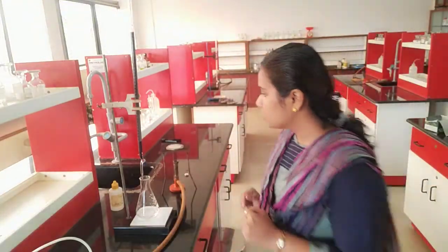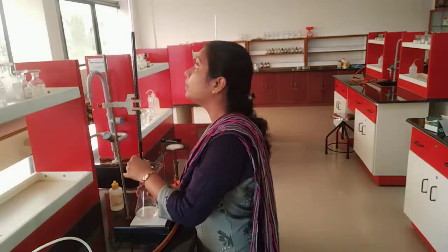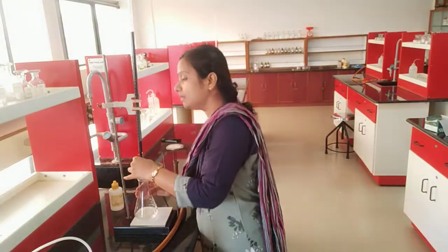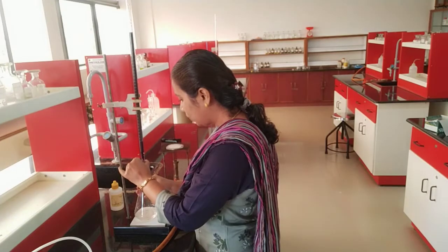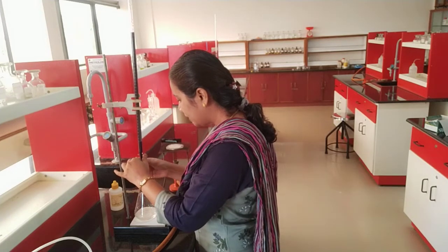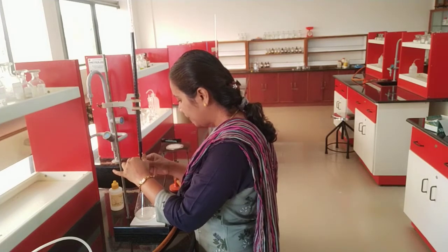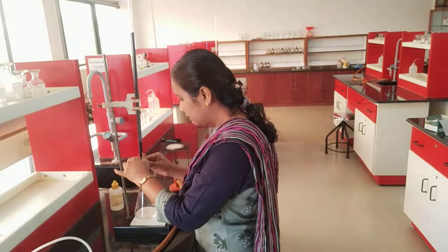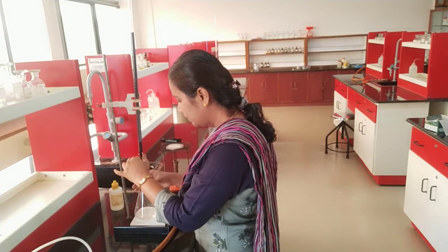So we are going to proceed with the experiment. I know that my initial reading is 15. So what is the end point? The end point is the appearance of pale permanent pink color. So I am just trying to proceed.